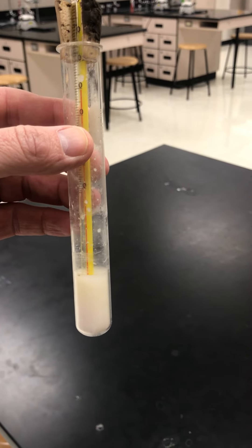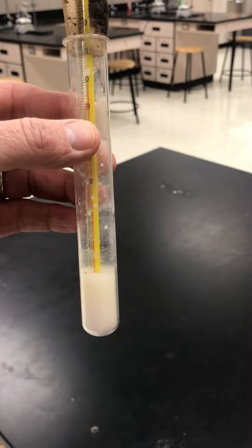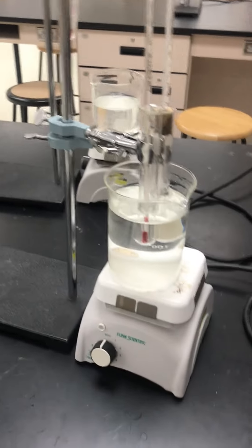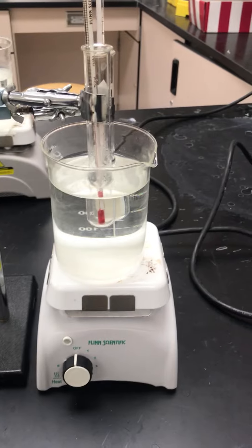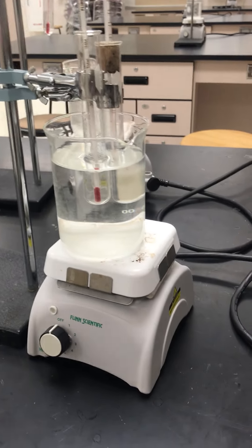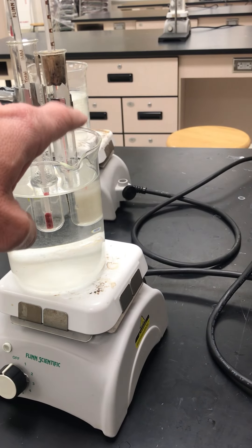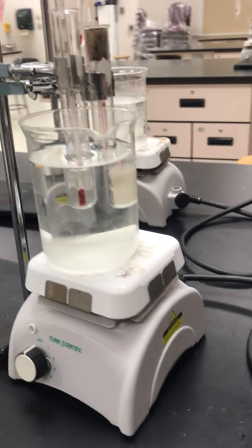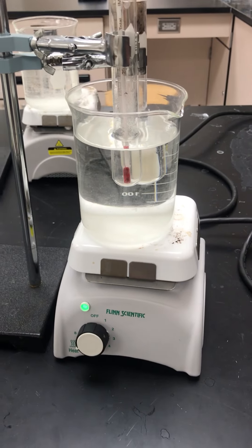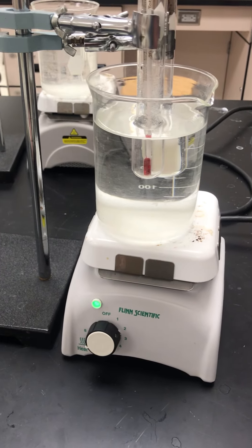And what we're going to do is we're going to melt that and then we're going to freeze it again and take the time and temperature of that. So the setup looks like this. We have two test tubes in the water here. One test tube is going to be water, the other test tube is stearic acid. And we turn on our hot plate and we're going to let that heat up so the stearic acid melts.